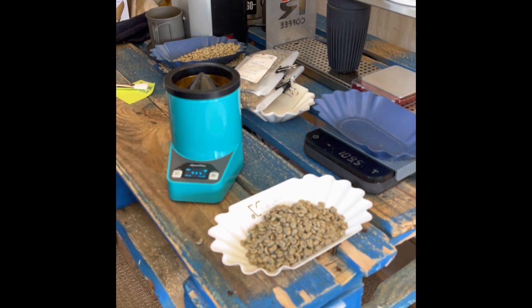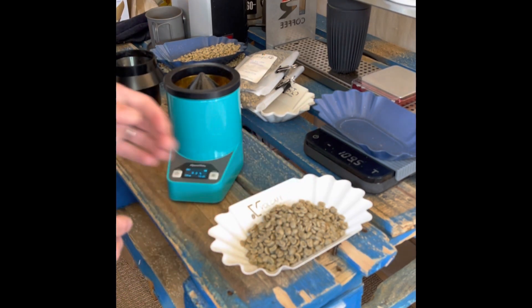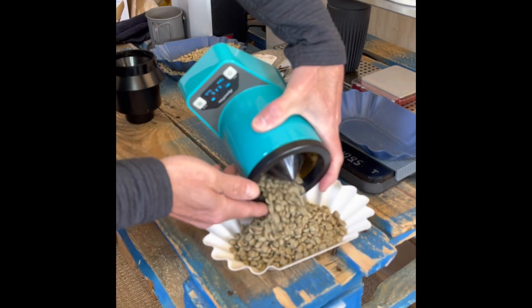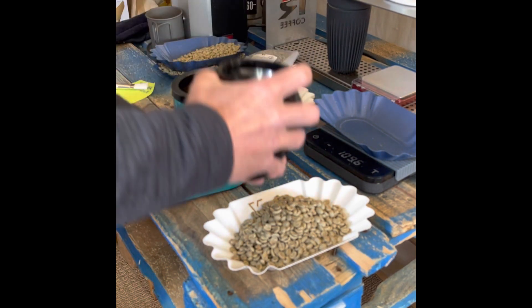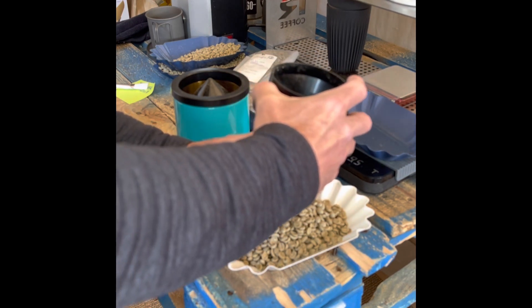That reads 8.9% and 736 grams per liter. This is actually reading higher than it did last time — I'm really surprised. Last time I did this, the AA had an 8.5 reading. But it's good — maybe because it's been sitting out, although green coffee changes slowly.